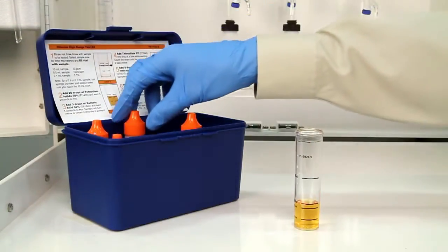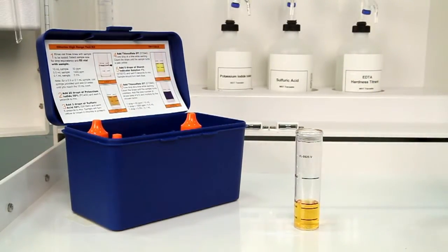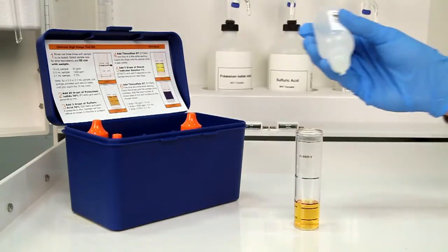The next step is to add five drops of starch indicator solution 1%. Hold the bottle vertically to get a consistent drop size.